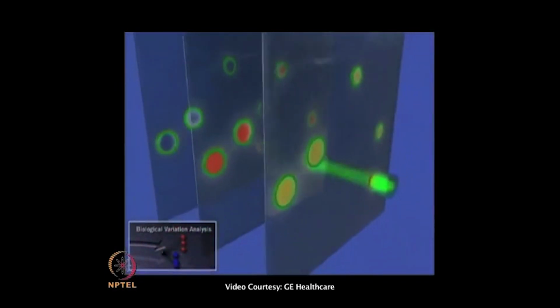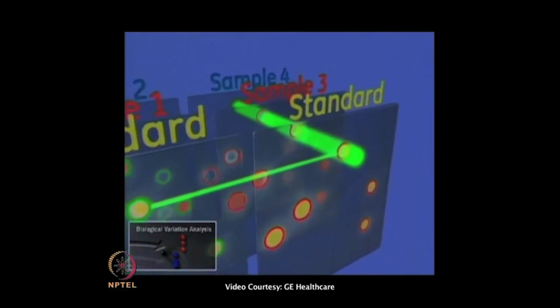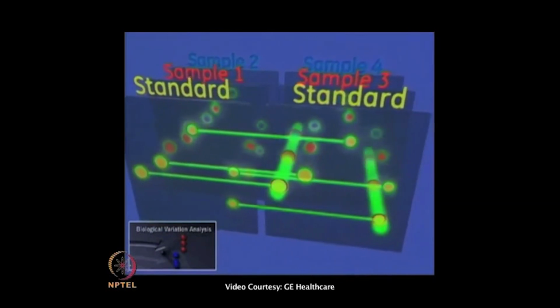And after finishing DIA, we can go to BVA. In BVA, we can compare all DIAs together. As you can see in this video, first it matches between the standard gel, and from the standard gel to the corresponding DIA. It matches each and every individual spot, and it will give you the final data.